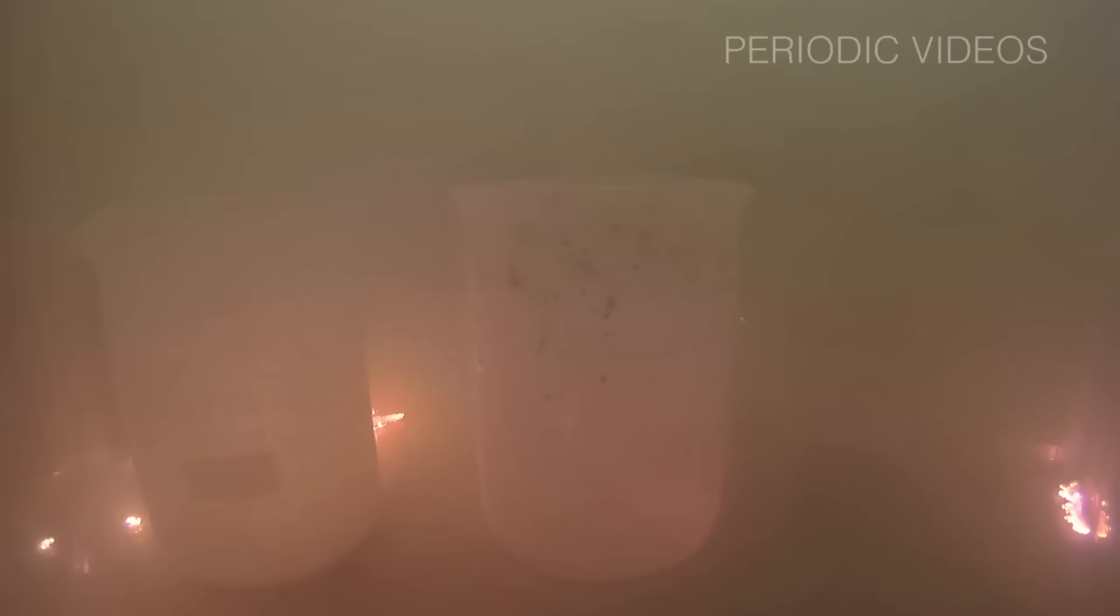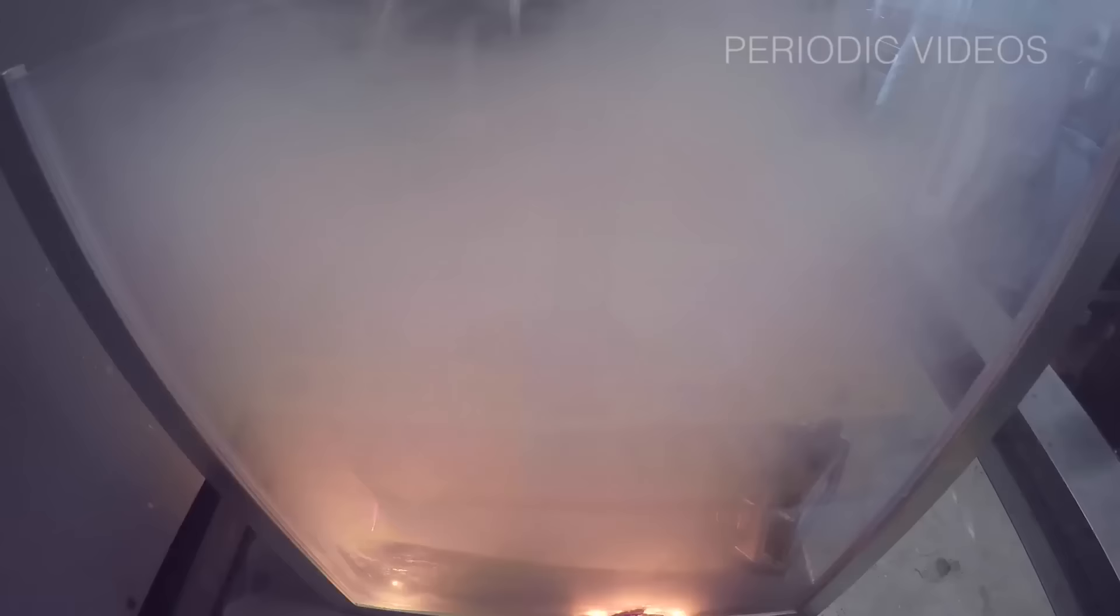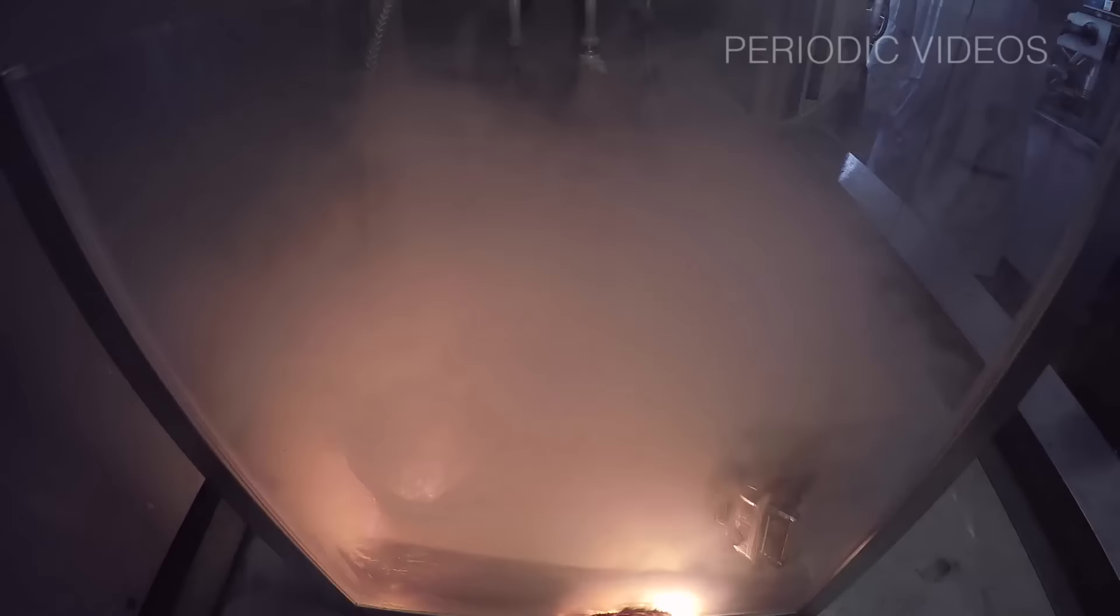It wasn't actually the plastic, but it was the silicone sealant which caught fire. I didn't think that silicone burnt very much at all. But when you see what happened to Neil's box, we had demonstrated beyond doubt that when you have an atmosphere of oxygen, silicone burns pretty well. And I'm sad to say that Neil's box may be ruined. It's certainly not in a good state.